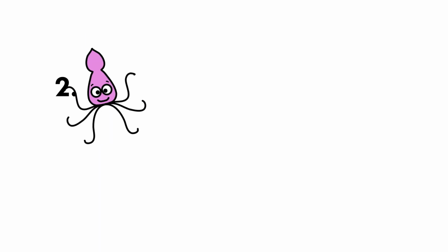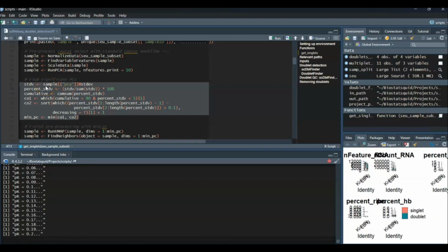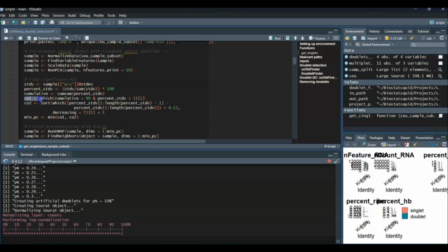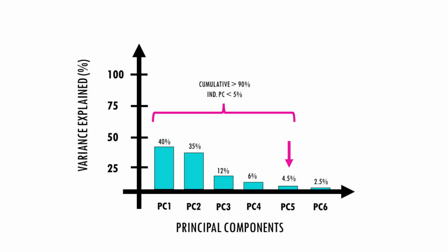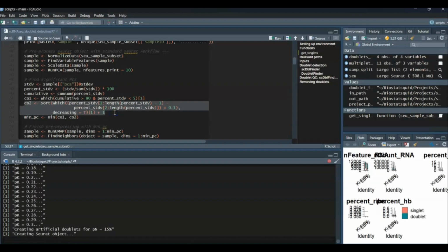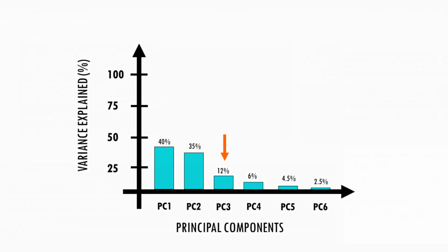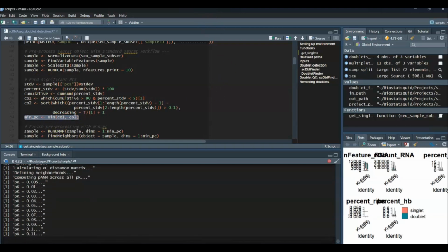Now let's check the optimal number of PCs, or principal components. These lines basically calculate the optimal maximum number of PCs to include. I have a more thorough explanation in the blog post, but basically it identifies the first principal component where the cumulative percentage of variance explained is greater than 90%, and the contribution of that individual component is less than 5%. And then it identifies which consecutive principal component has a large drop of more than 10%, or 0.1, in their percentage contribution of variance. And then it takes the minimum of either. If these lines are a bit confusing, check out my blog post for a more thorough explanation. But the main message here is that it's finding the optimal number of PCs that capture the variance in our dataset.